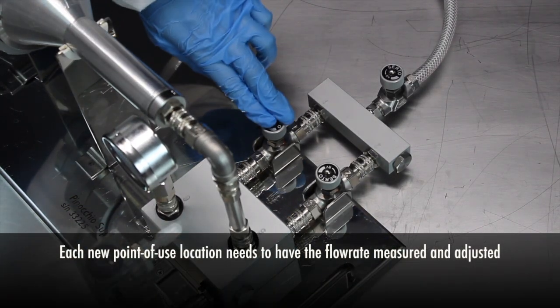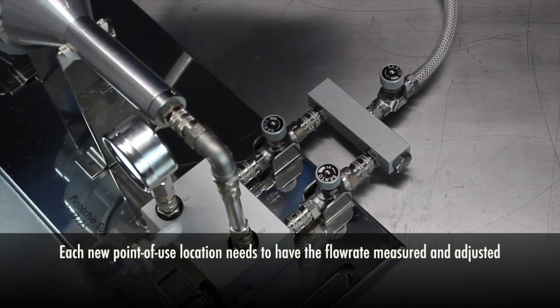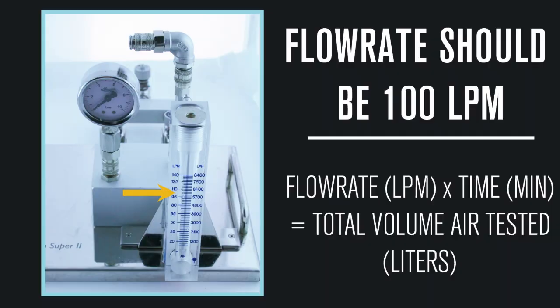When you've reached 100 liters per minute, close D1 on your air inlet connection to stop airflow going to the flow meter. Your flow rate is now established for point of use. Do not adjust D again.